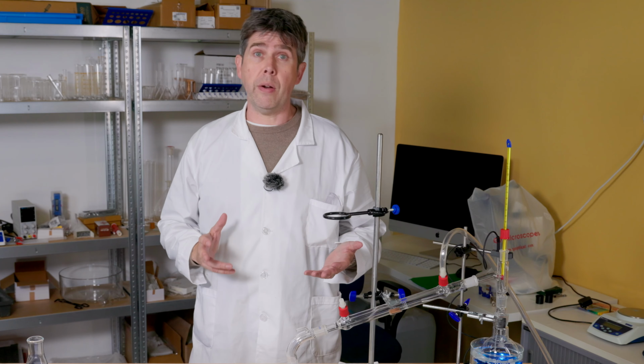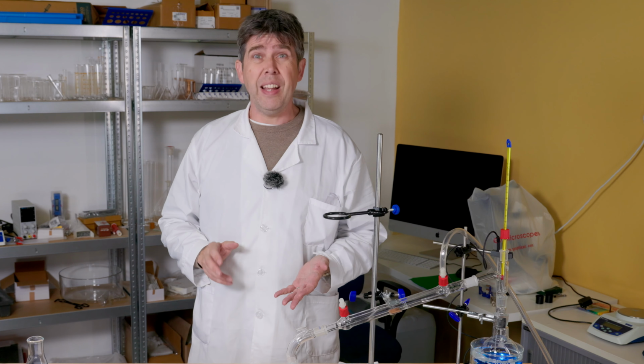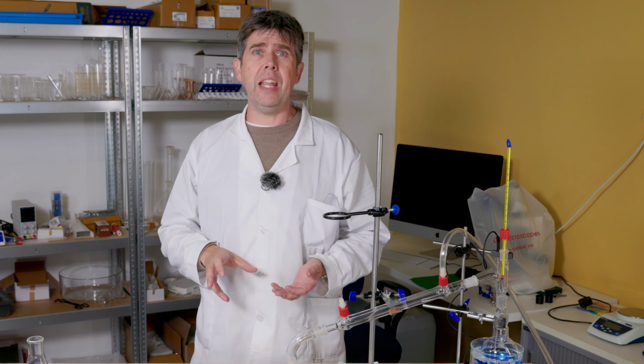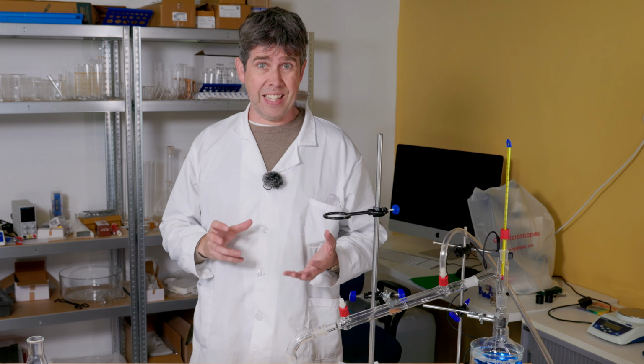Welcome to the third of our separation technique videos. There is a general overview available and that is linked above, but today we're going to focus on the details of this important technique, distillation.